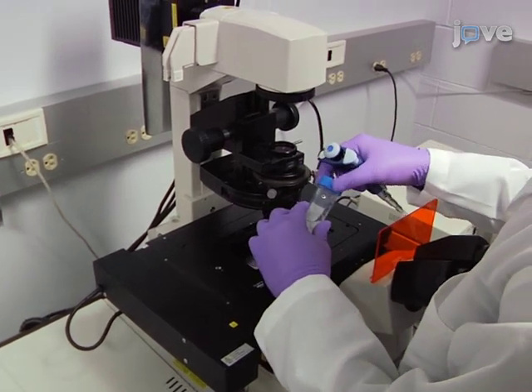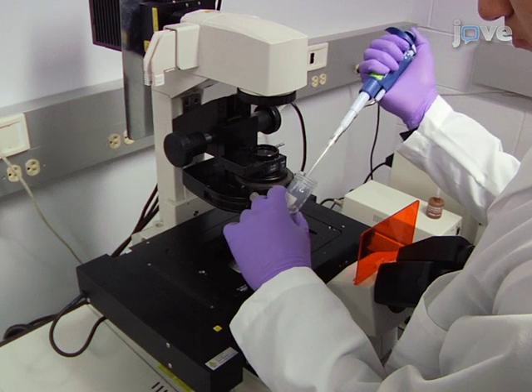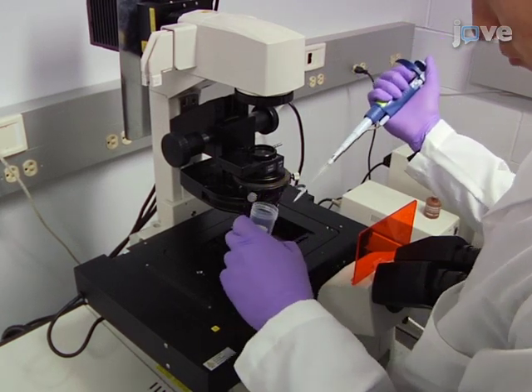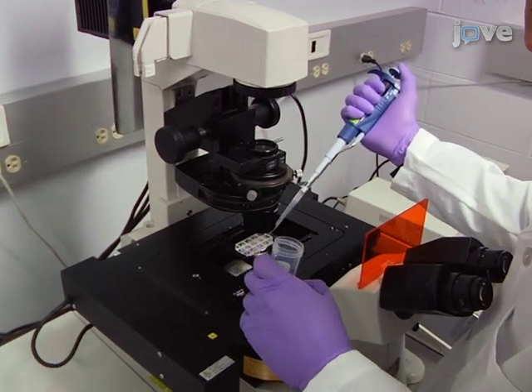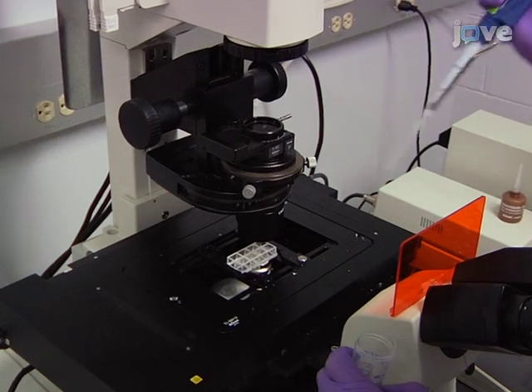For image acquisition using a confocal microscope, apply stress stimuli by slowly injecting 200 microliters of 150 millimolar sodium chloride, ice-cold water, or 1 millimolar hydrogen peroxide solution into the chamber just prior to acquiring images.